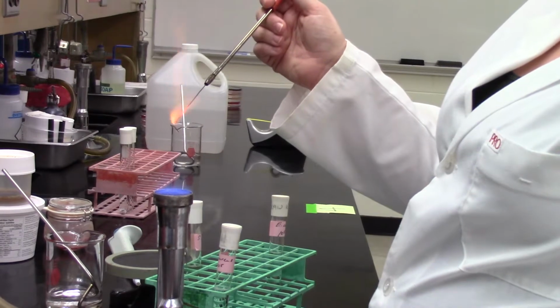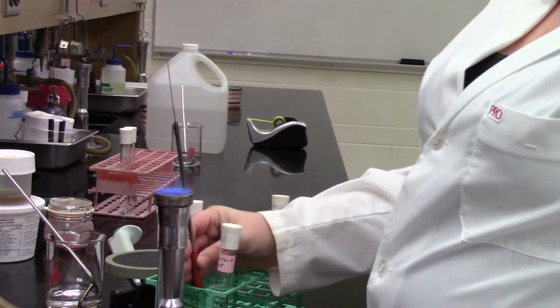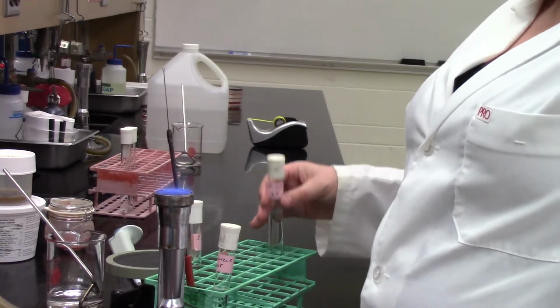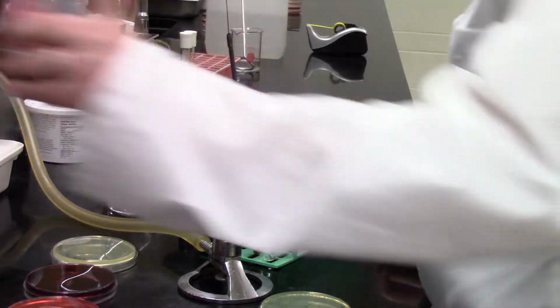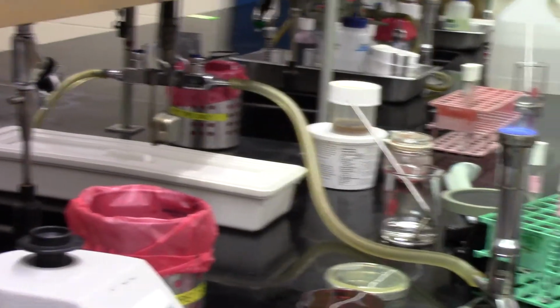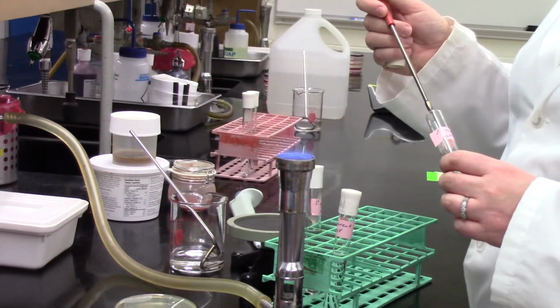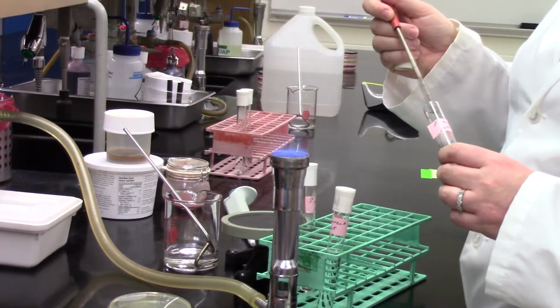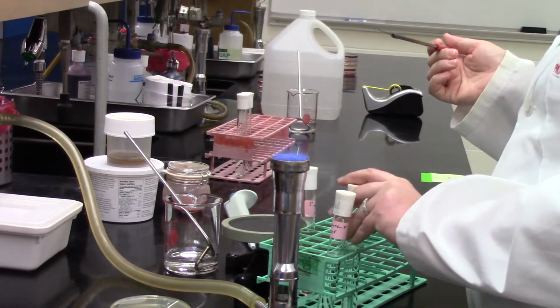So you can start, if you want, thinking about what you would expect to see on these plates after this inoculation. You might already know from lecture which of these are gram-positive and which are gram-negative, but a lot of the selective media is selecting for one or the other. So selecting for a broad group of bacteria, such as all the gram-positives or all the gram-negatives.